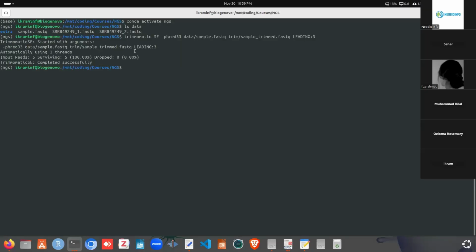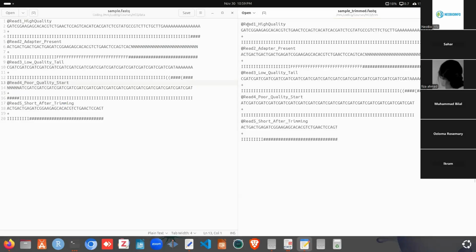After that, we need to check this. We have a total of 5 reads, and after trimming, all 5 reads survived, and Trimmomatic didn't drop any read. We check the output. As we see, read 1 is the same. For read 4, look at read 4 here and read 4 here. It removed the first 5 bases and we don't see the hash symbol here. This is how the LEADING command works.